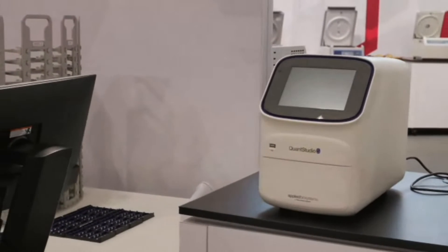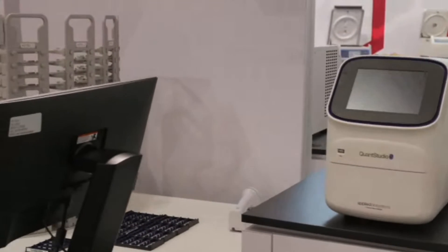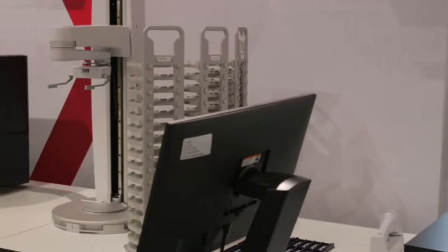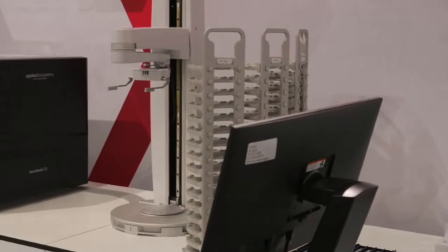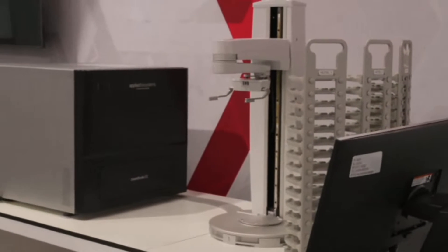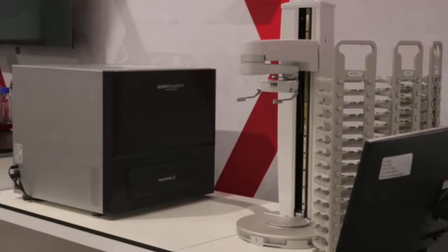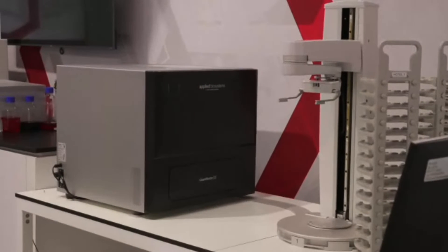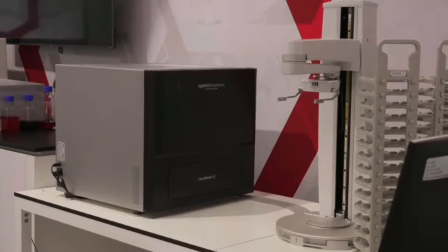And we are going to be talking about how to choose between qPCR and what you can see here now, the digital PCR system, which is called the Quant Studio Absolute Q.